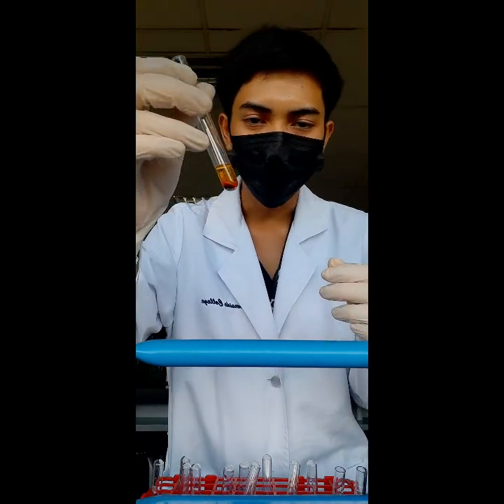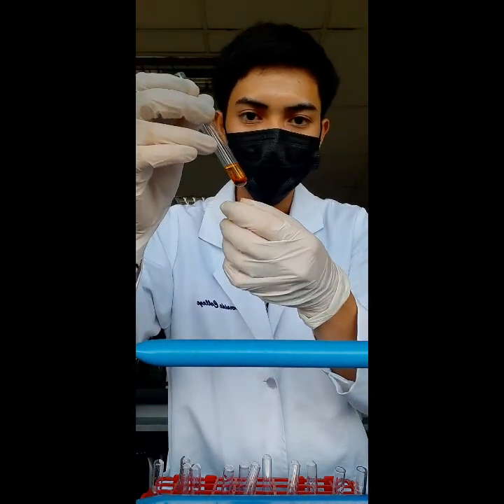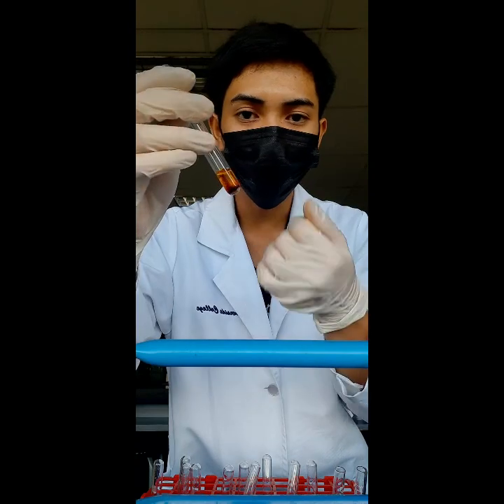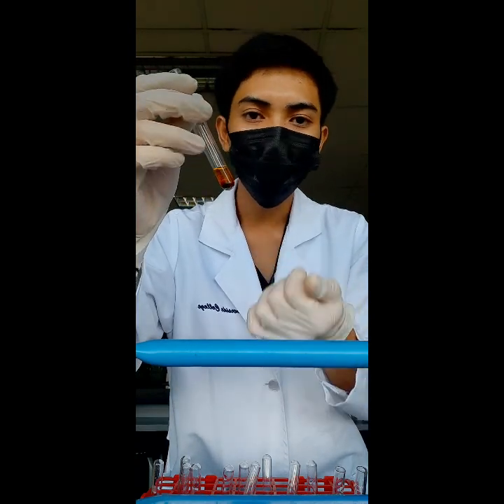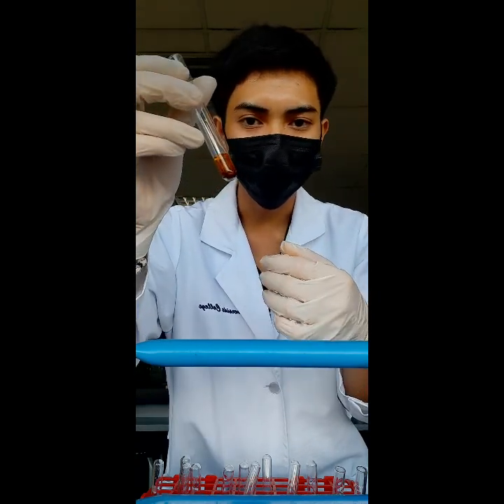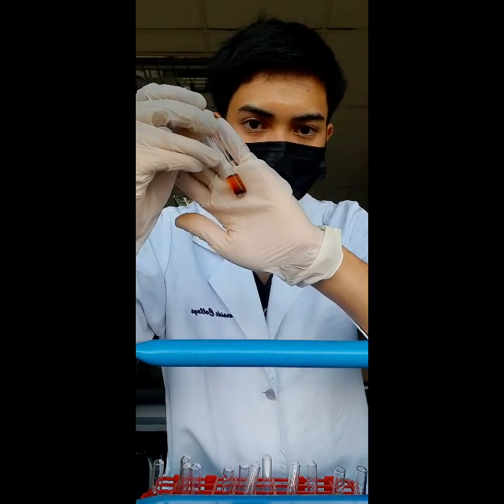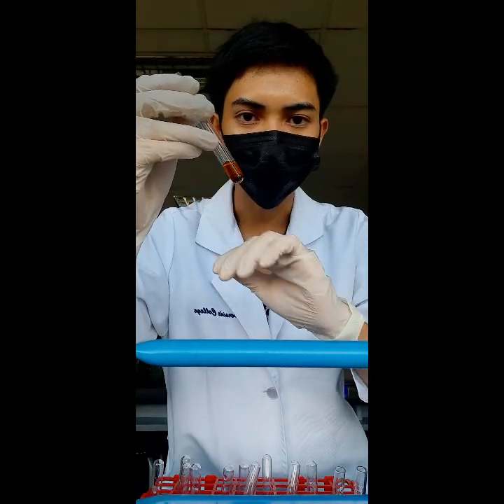Right after centrifugation, this would be the positive reaction for unknown 3 — the compound belonging to our Group 1 anions. As you can see, it has developed yellow precipitates.